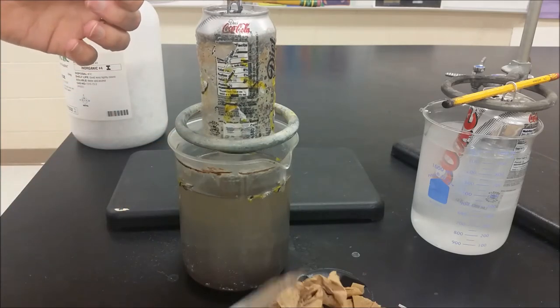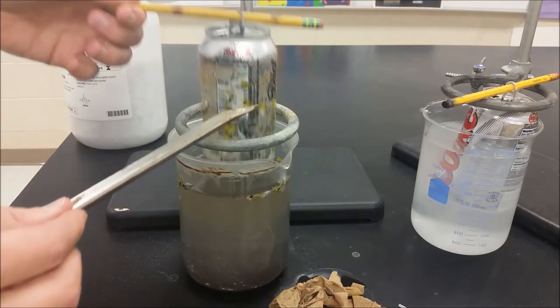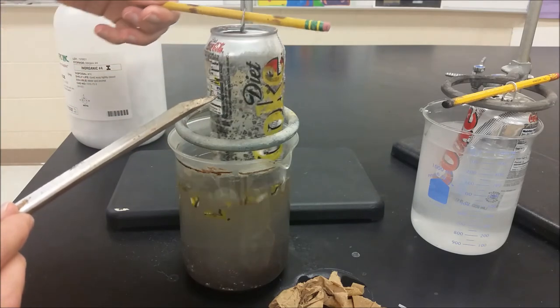For the rest we have kind of the packaging here and you can see that when I set it down it just kind of crumples and goes away. So we have that plastic left.